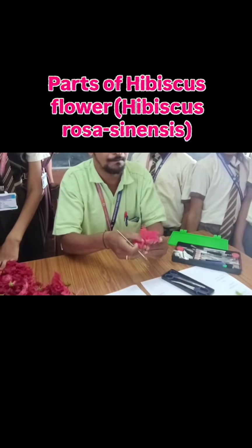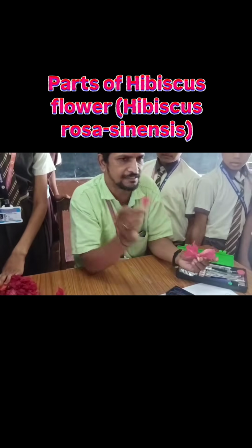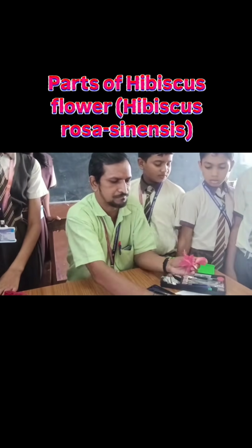Yes. Then this is called the petals. So how many petals here? 5. And it is also called the corolla. Okay, so these are the petals.